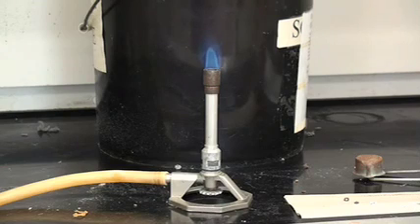Okay, the next piece we're going to look at is calcium. Calcium is also in the group 2A metals and it is below magnesium in that group.